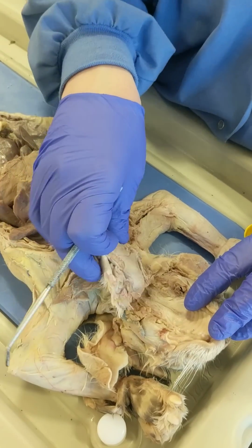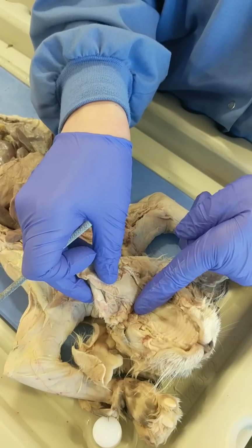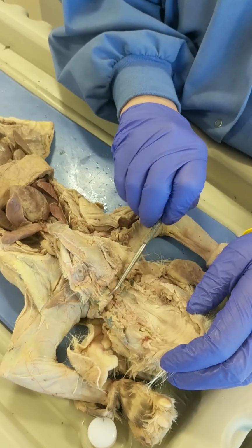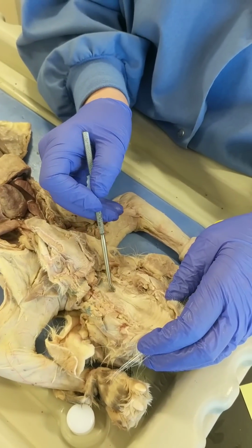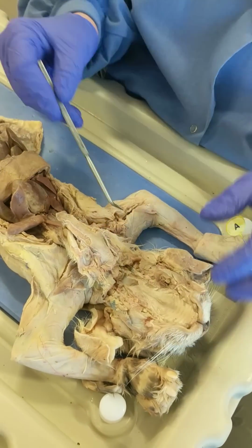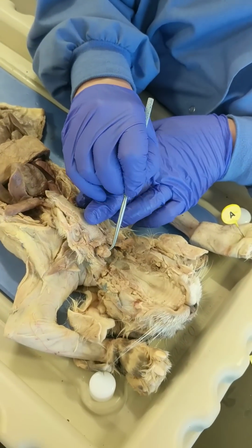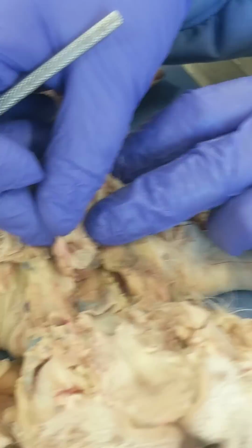Notice that this is essentially the oral cavity. If we open the oral cavity further or pull the jaw away, we're opening the pharynx or the pharyngeal cavity. And this leads to the nasal cavity. So underneath the soft palate leads to the nasal cavity. At the base of the pharynx is an opening to the respiratory system and an opening to the digestive system.